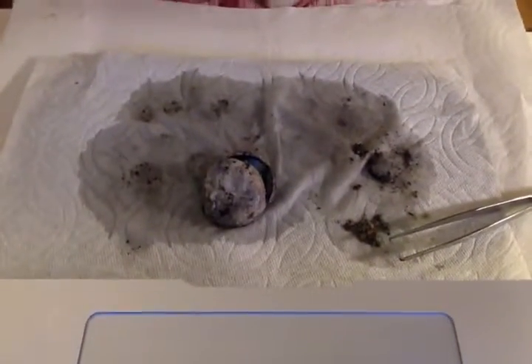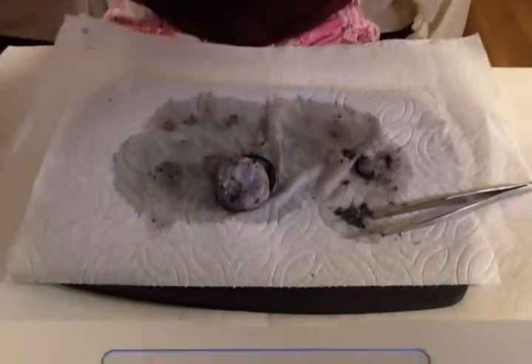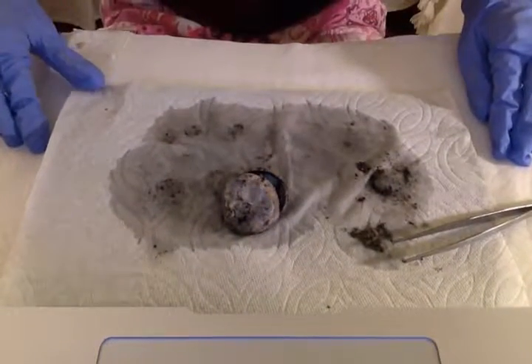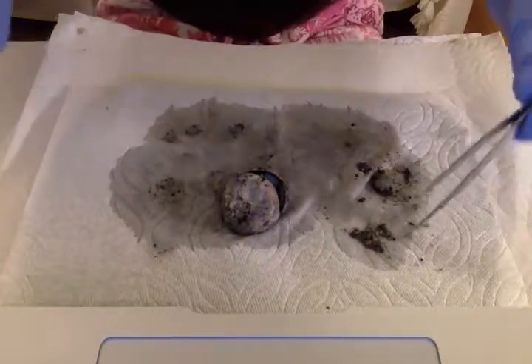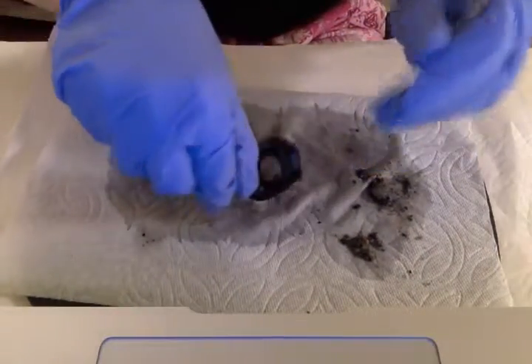I am going to show you some of the structures that I found in my cow eye dissection, which I'm guessing you didn't want to see the whole dissection, so I hope it's okay that I'm just pointing out structures after the fact. But anyway, I'm going to bring my computer down here, as close as I can. Let me see if I can push my computer back a little bit so that you can see all these structures. Okay, I hope that this is good enough. I'll do my best to point everything out to you.